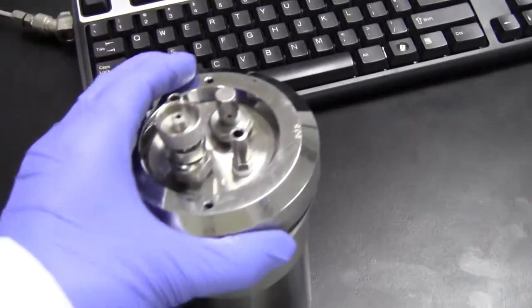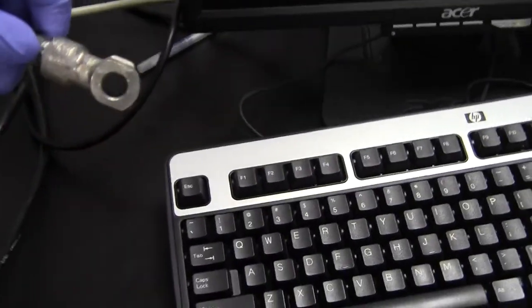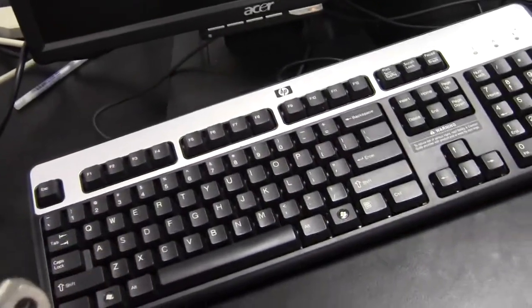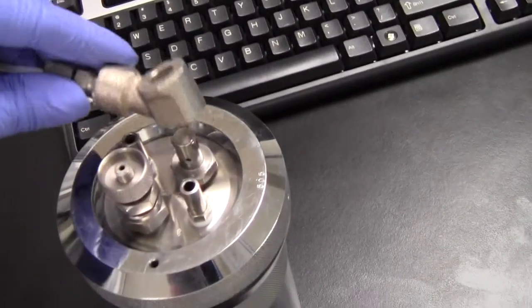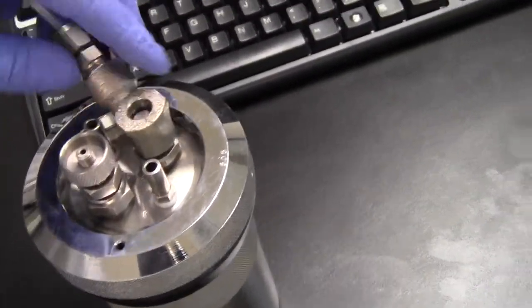At this point we need to add the oxygen, and the oxygen comes from a tank across the table here. But this is the inlet valve, and it fits actually on this part right here.